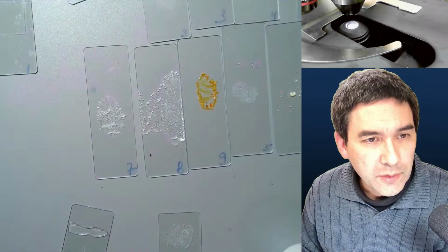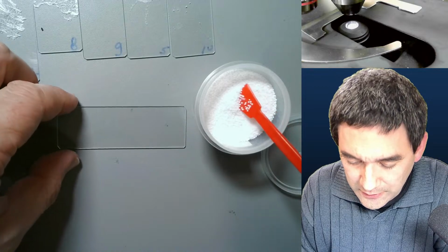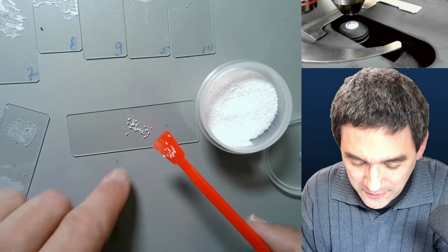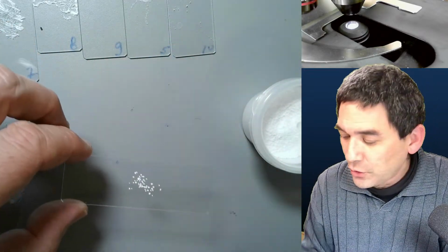So you would like to probably see what I'm doing. Let's move this up a little bit, or let's move this over here. Look at the static electricity here. So let's put this back in here again. So you close it off. And I put this directly under the microscope, and then I'm going to add some water. But because there's the danger of the whole thing falling off, I will first add a cover glass to protect it a little bit better. And then I can always add a little bit of liquid. So I just put a cover glass on top, and that's how it looks.